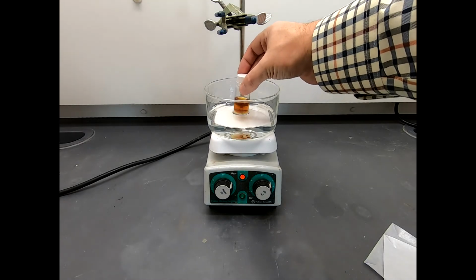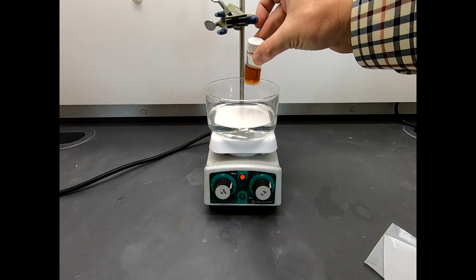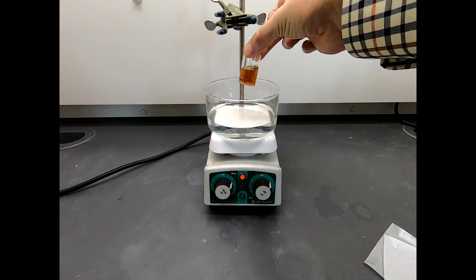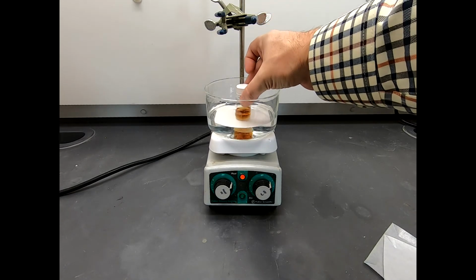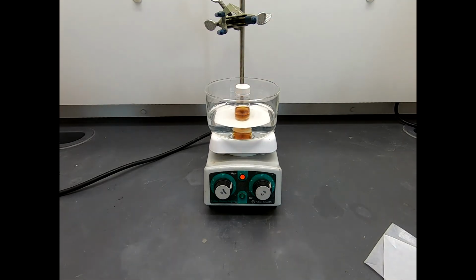So let's just take a visual look. This is roughly dissolved. I think some of the bicarbonate is still in solution. It's a clear solution. Looks like it's kind of the brown color of the para-toluidine. And now we'll just let this stir and warm up. And hopefully as the reaction goes, maybe we'll be able to observe some physical changes in this reaction.